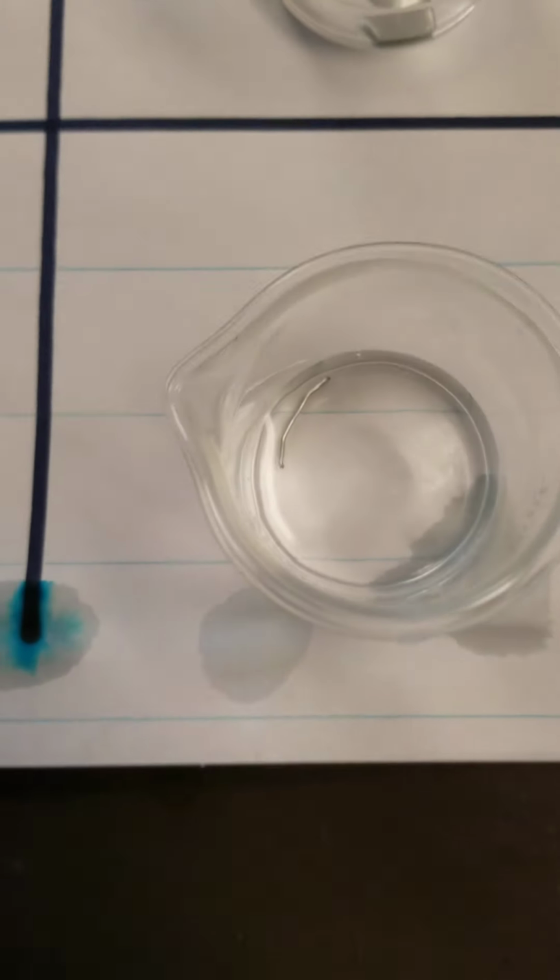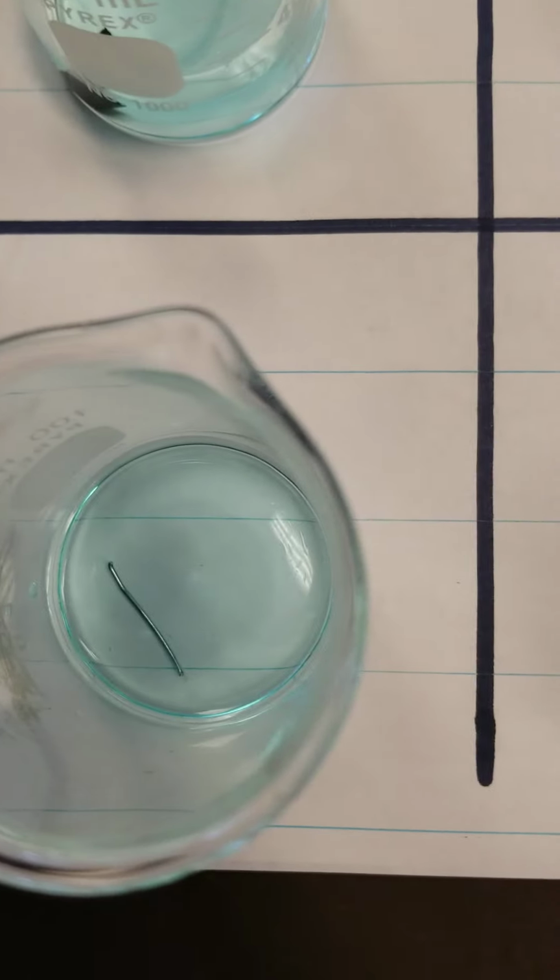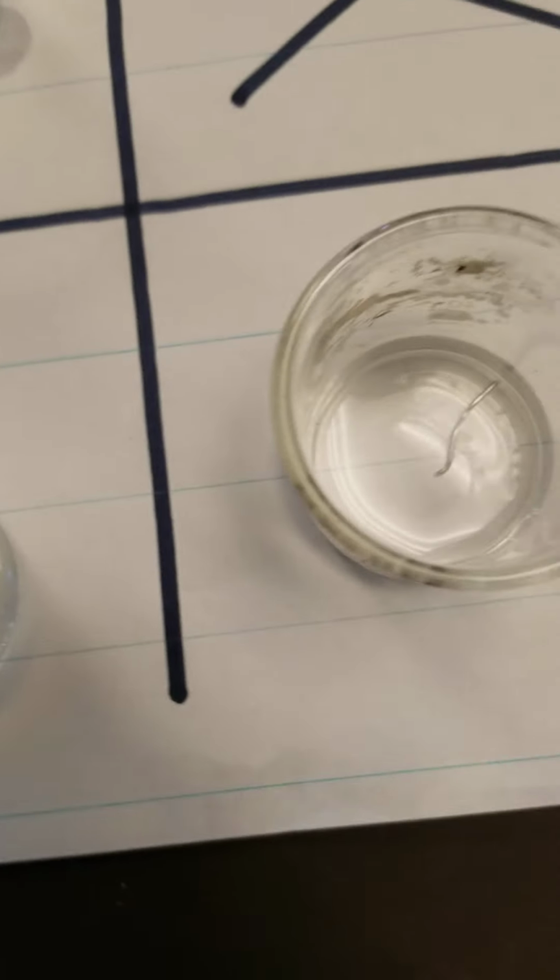Now, on the opposite end of that, if we look at the silver metal in each one of these beakers where I've put solution, and you can kind of see it sideways, so you can see that solution's in all of these. Not one of these from the silver is being oxidized. So silver metal to go to an ionic solution doesn't happen all that easily, at least not with the combinations that we have here.